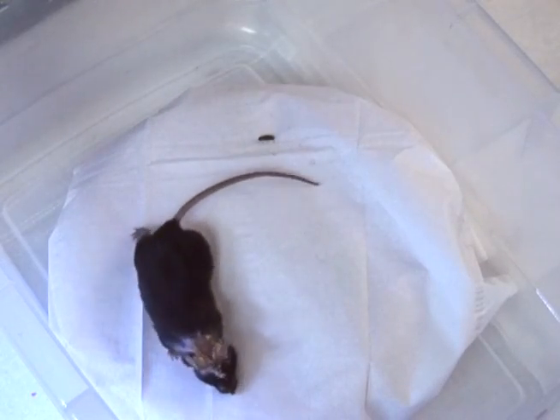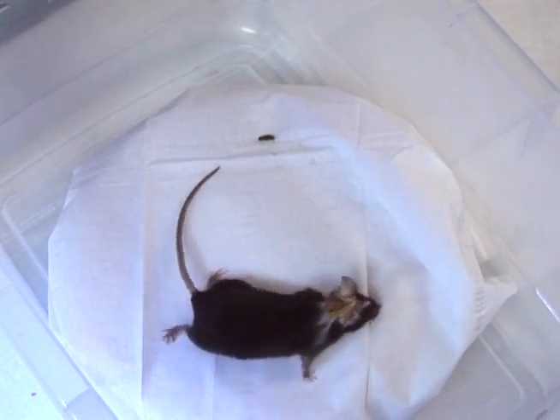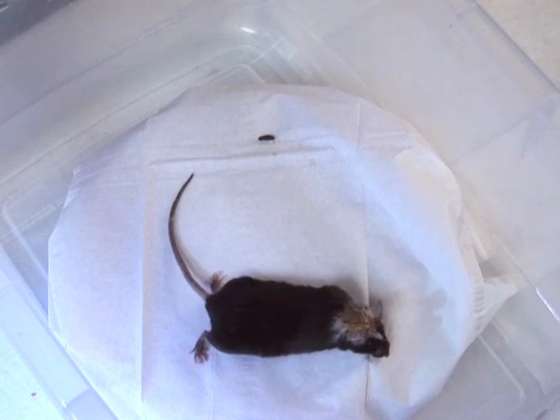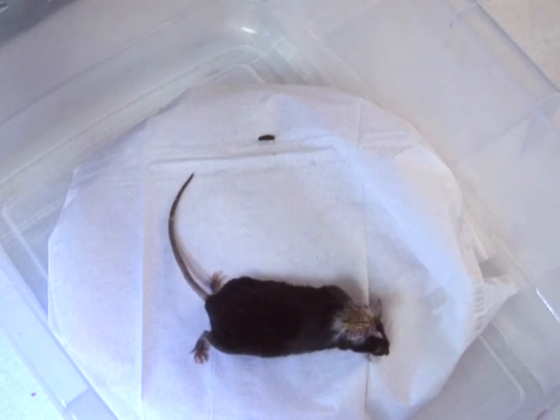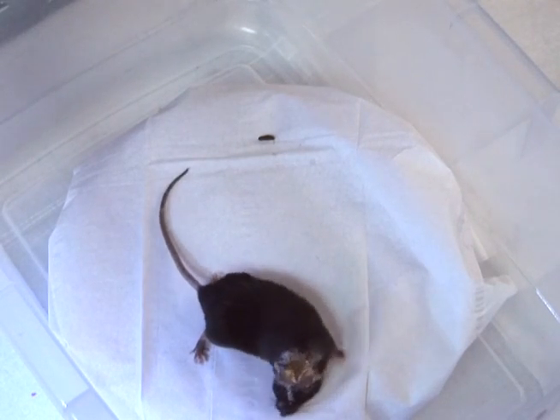Again, monitor the mice daily after the surgery to check for pain or discomfort and infections and administer analgesics as needed.